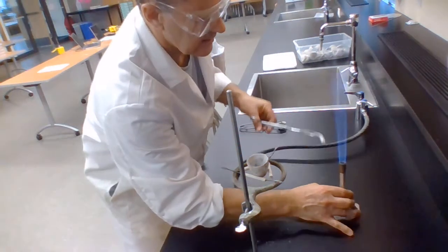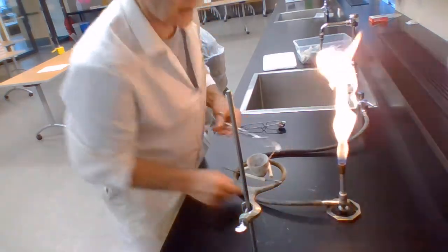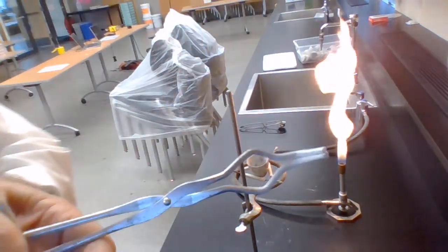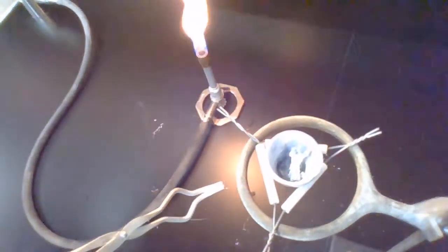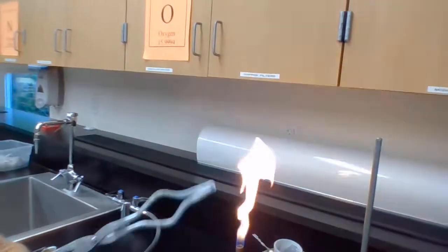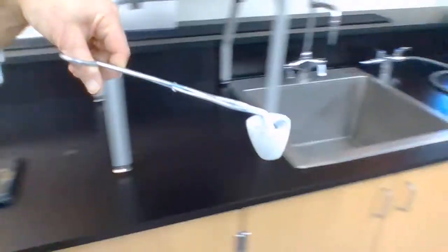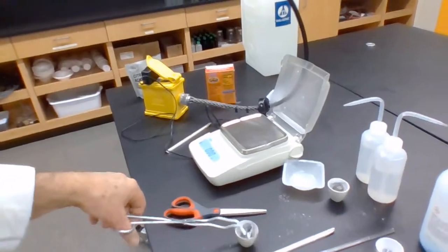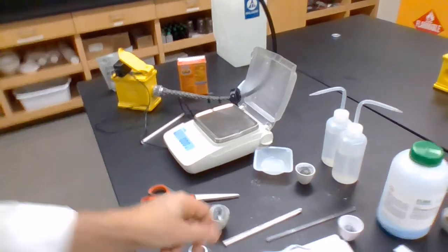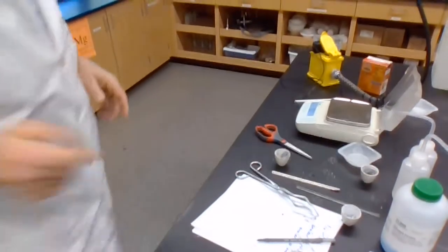Alright, I'll take that back to safety flame by excluding the air and reducing the oxygen flow to the methane. And we look at what we've got there, and it's a massive white mass in there. So, I'll take that with me, and I try very hard not to drop it, because the last time I did this, I did drop it. And because I dropped it, this is the second time I'm doing this, and I do not want to be doing it for a third time.